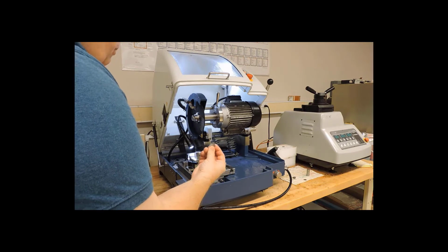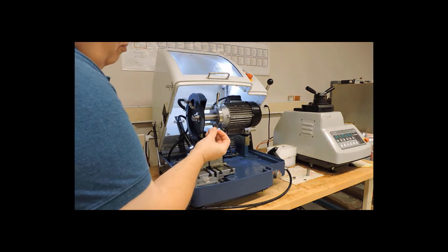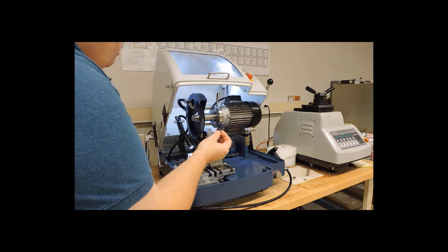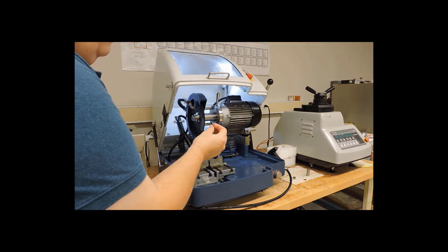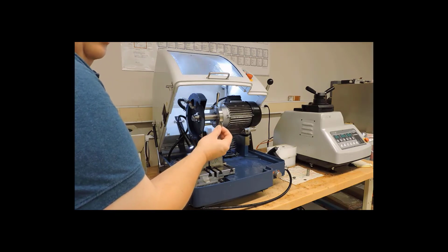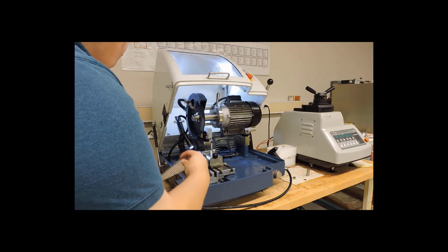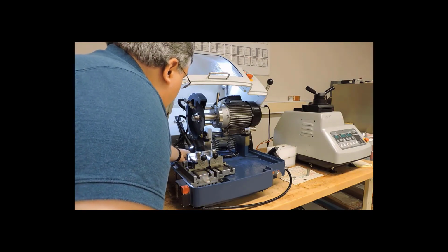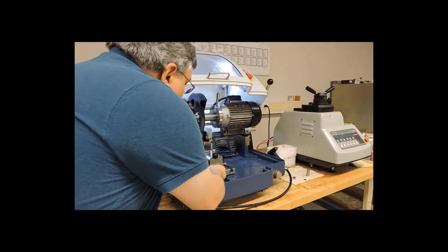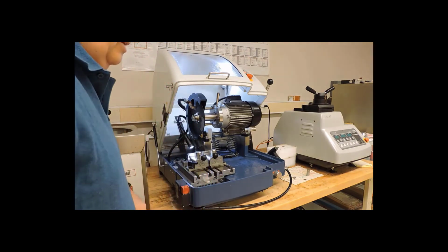And here's our specimen. And that's pretty close to the thickness of a nickel. So now we'll put it on the card between the cutoff saw and the mounting press so that the mounting group can encase this in plastic. The last thing we need to do is to put this little basket back in, slide it back into that slot from behind, drop it back into place.